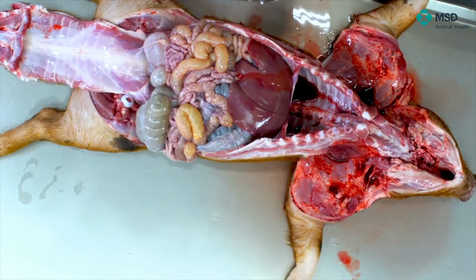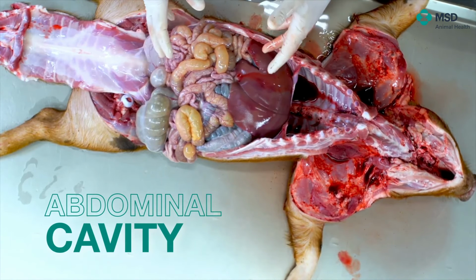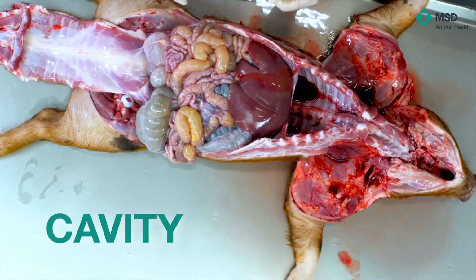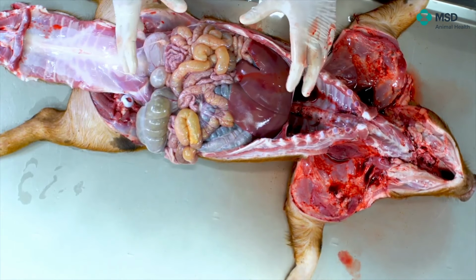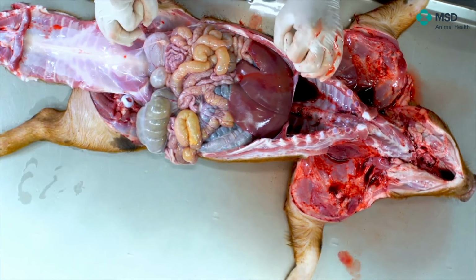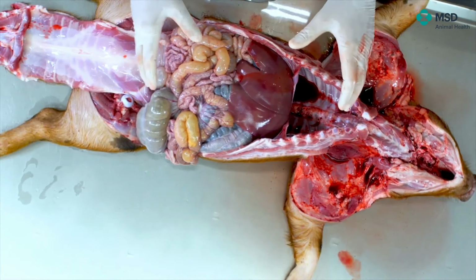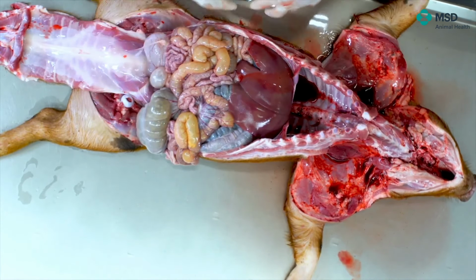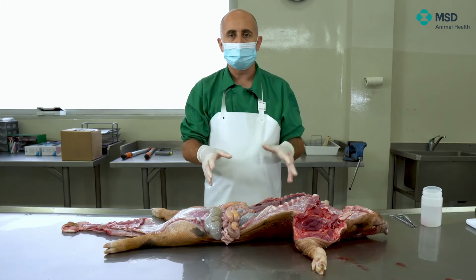Okay, we have the abdominal cavity here, and we need to remove all the intestinal loops. There are several ways of doing so, but the one that we recommend, sometimes, especially with the students, is to make some knots, especially at the rectum, at the duodenum, in order to ensure that there's no content fading away. So we will do such a procedure here.